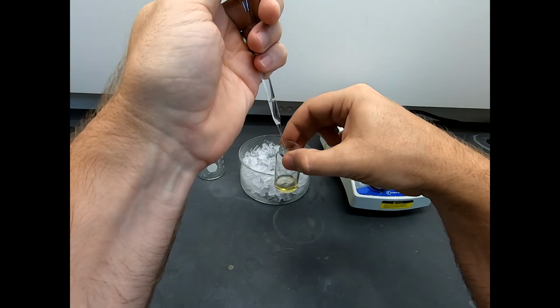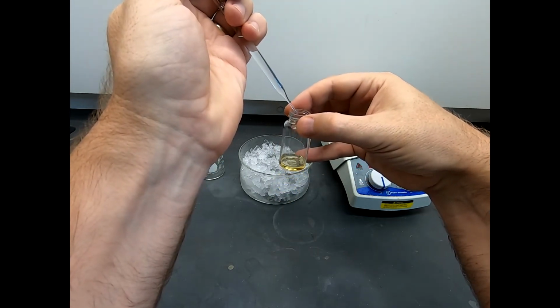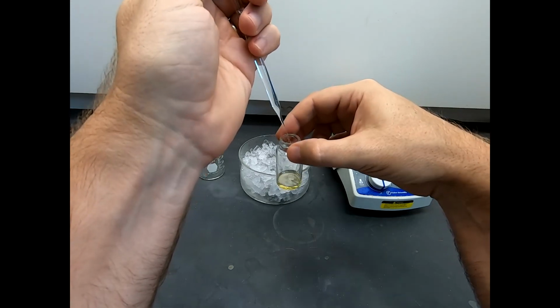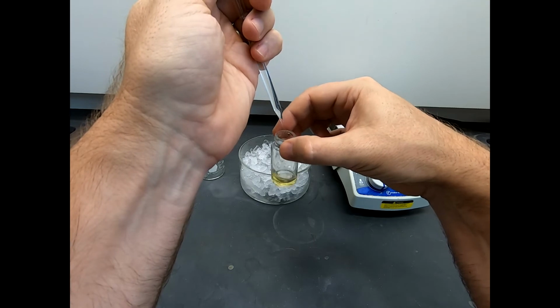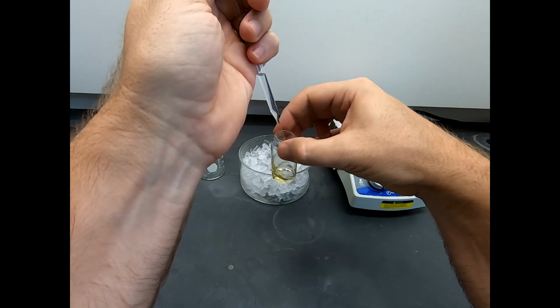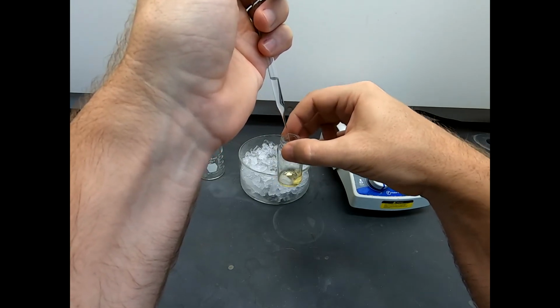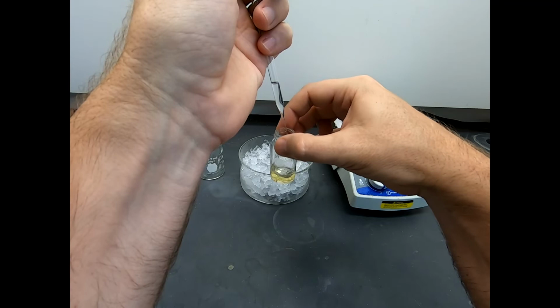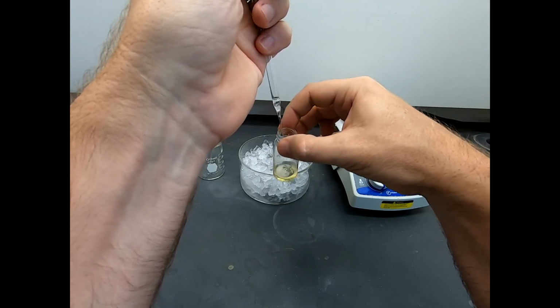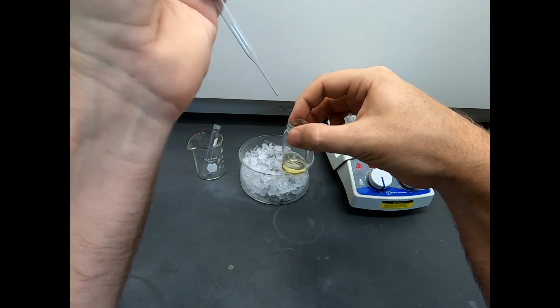So presumably what's happening is, as we add the hexane, the solvent becomes less and less polar, and eventually our product will precipitate out of the very nonpolar solution. So let's drip, drip, drip, and I'm going pretty quickly, not super fast. You could also put a stir bar in here and have it stir on a stir plate as you do this. Lots of ways to get at this. I just want to mix in the hexane as I add it.